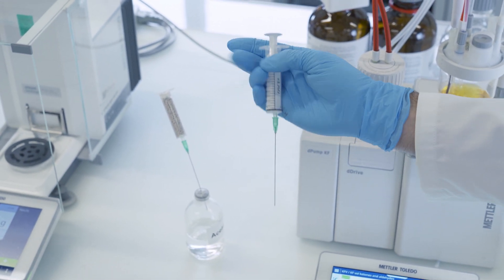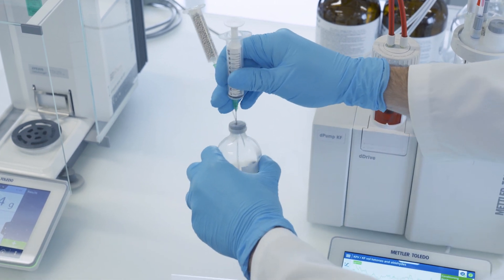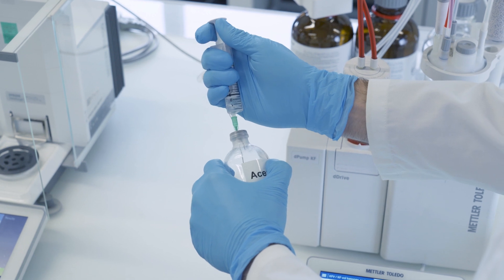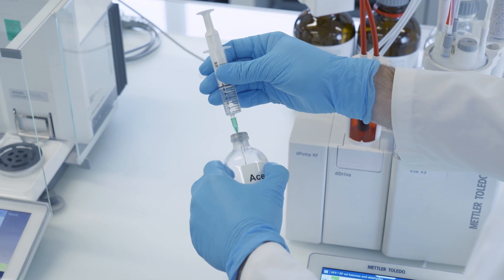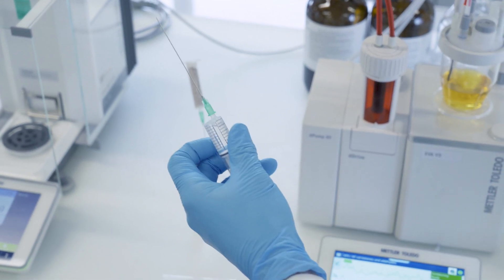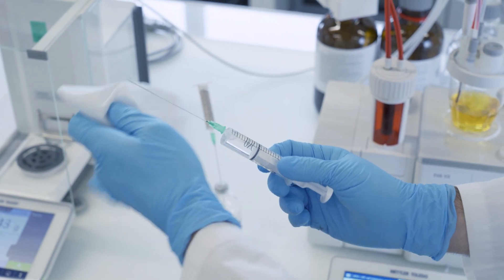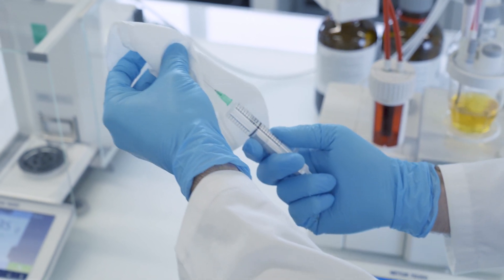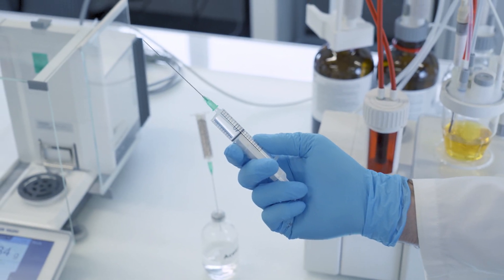And now we fill the syringe with as much sample as we need for a whole series of determinations. We make sure that there's no droplet on the outer side of the needle and it's better to remove any air in the headspace of the syringe.